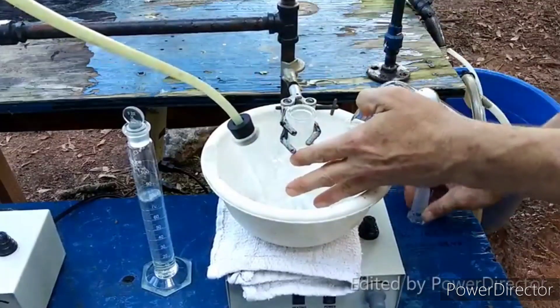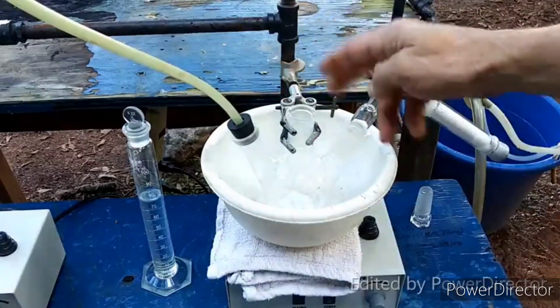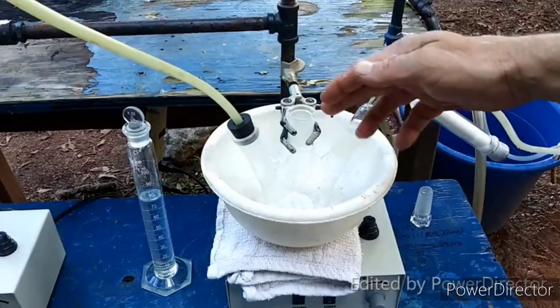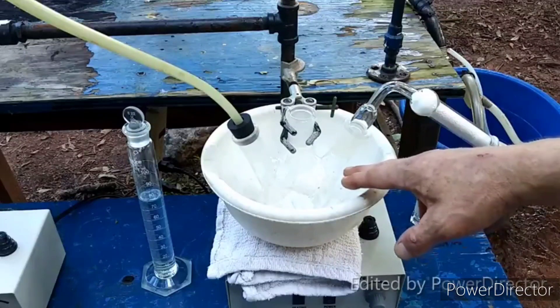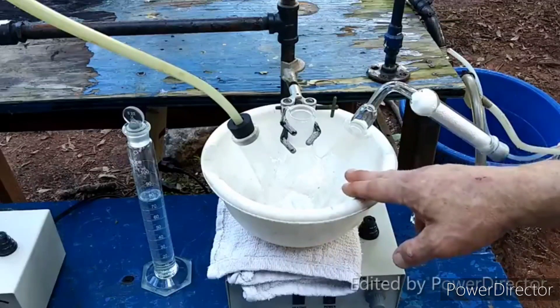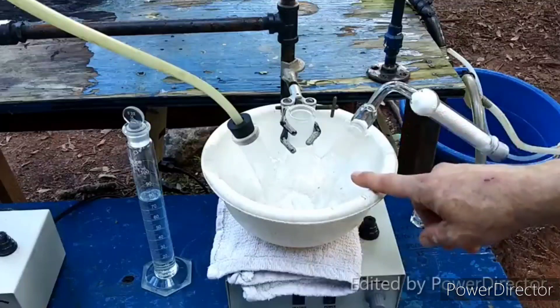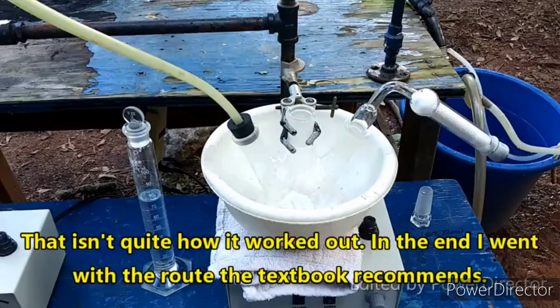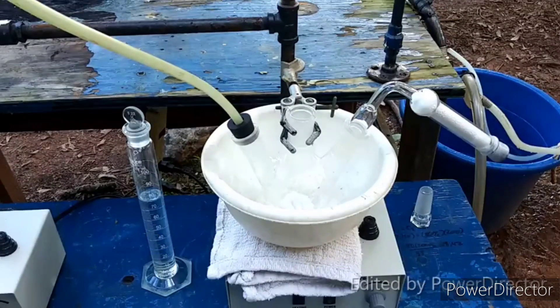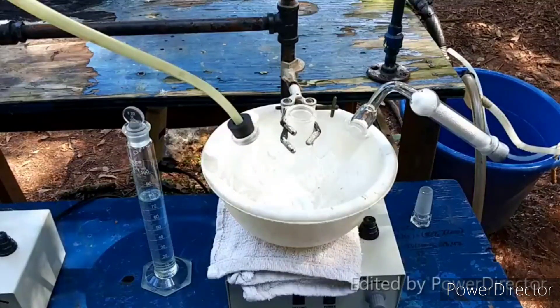I have this in a bowl because the solution has to be chilled after we form it. We are going to bubble chlorine gas through this in order to create a solution of tin tetrachloride. Then we are going to add ammonium chloride and allow it to crystallize out in the cold overnight in order to get our product. I have a drying tube on it.